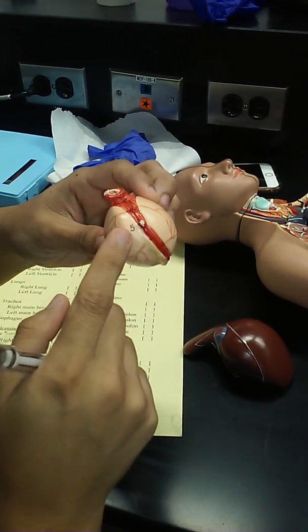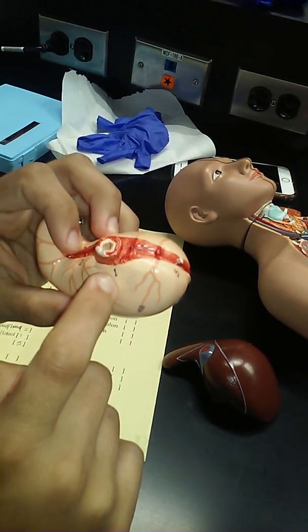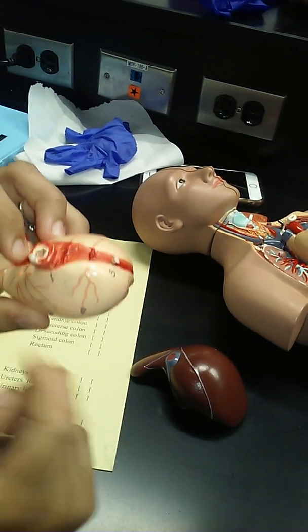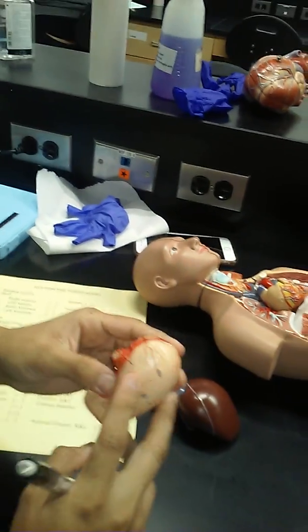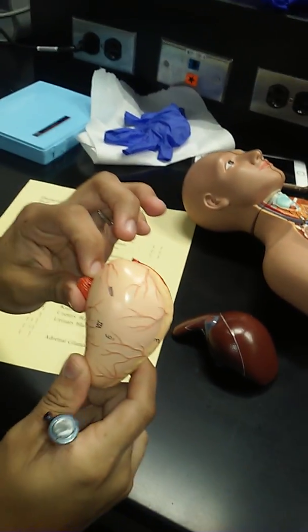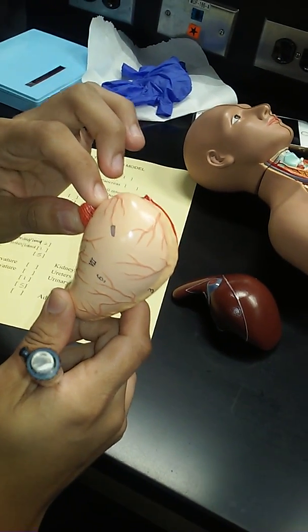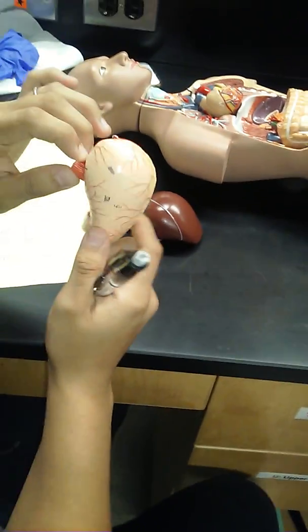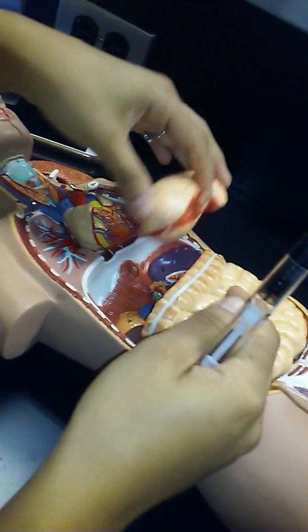Up here by the entrance is a little number 1. The area around the entrance into the stomach is called the cardia. Now, when I say that word, what does that make you think of? The heart, doesn't it? Why would they call something on the stomach with the word heart? Well, look at its position in the human body. What part of the stomach is closest to the heart? Put it back in so I can see. Closest is right here around the entrance to the food tube. So that number 1 area, right around the entrance, is the cardia.